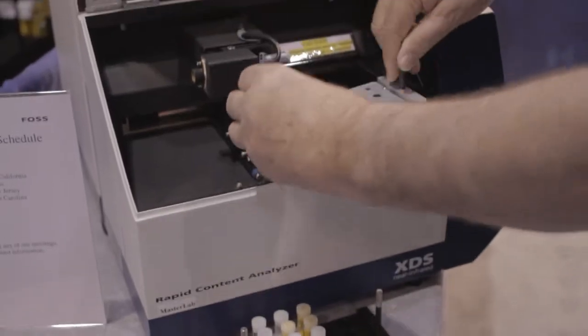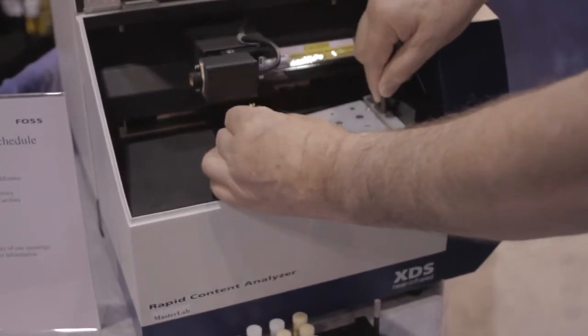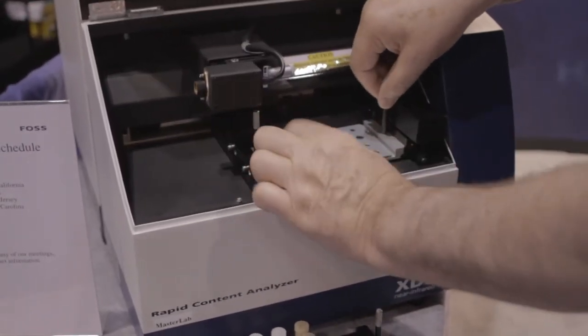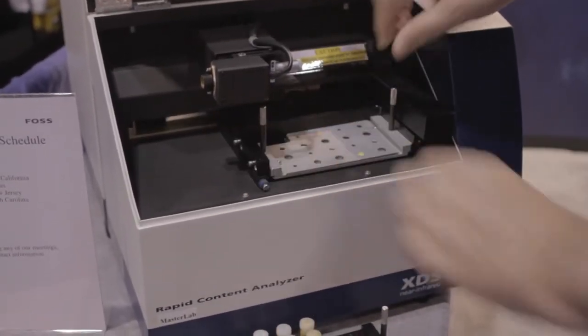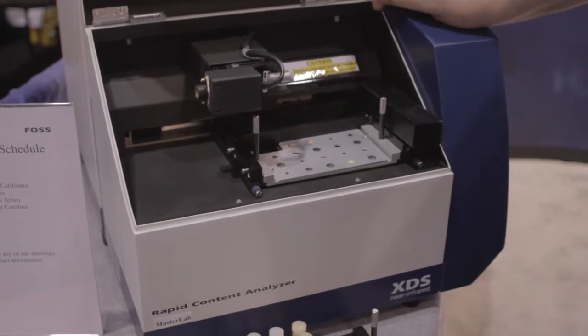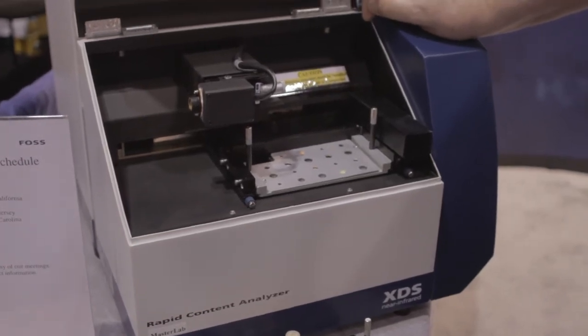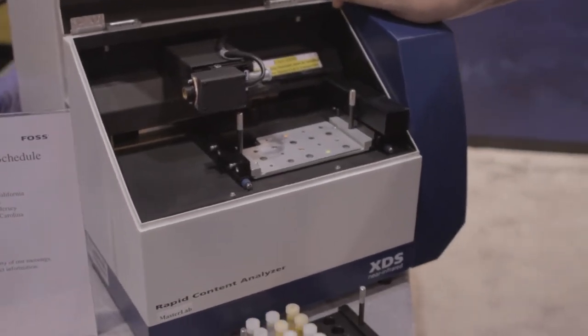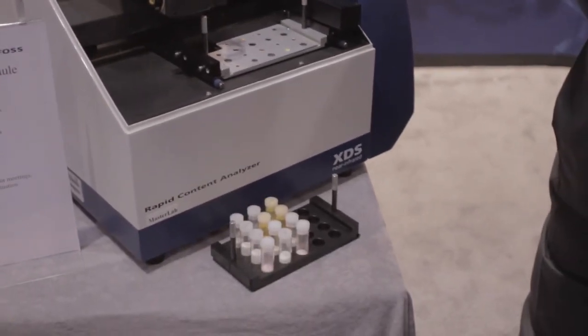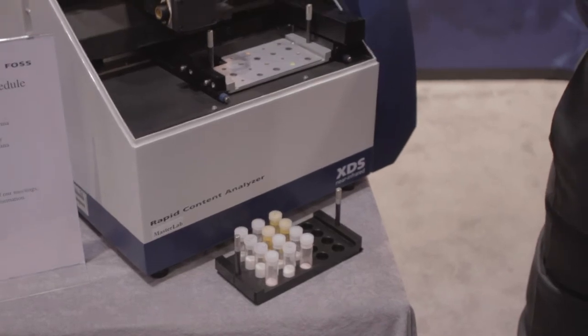we can put in a tablet tray and measure directly through the tablets to measure content uniformity or content assay for pharmaceuticals.